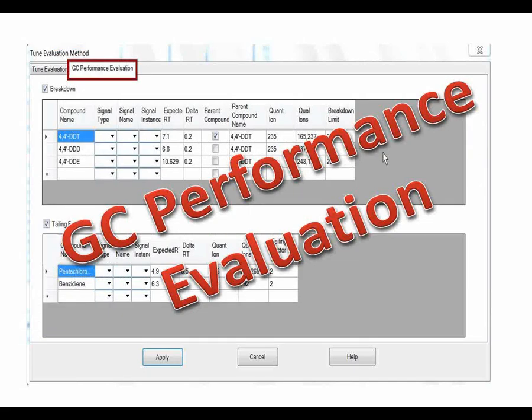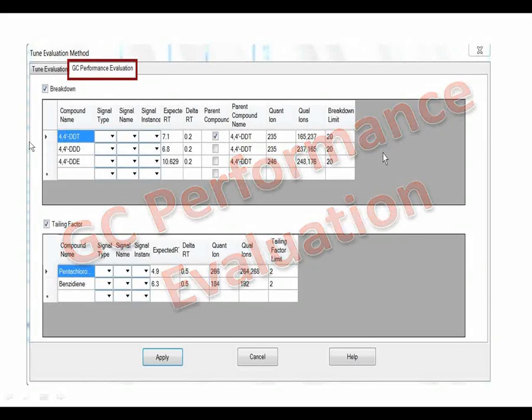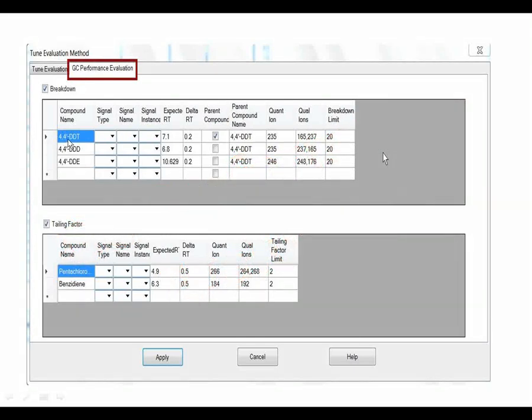Let's look at the other capability of this application, which is evaluating signals and their breakdown and tailing. It can be done for GC. I will show you that capability with mass spec signals. So here is DDT, and I'm going to look at the breakdown products. So first I'm going to define the signals with their retention time and quant and qualifier ions, so I can find those signals. And I'm going to take this DDT as the parent signal and evaluate breakdown characteristics of DDD and DDE in terms of the heat of the injection port.